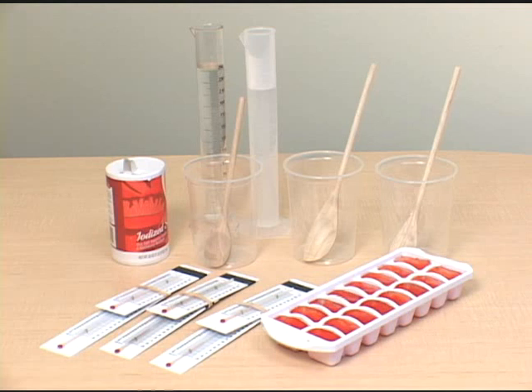Advanced preparation is important to lab work, so we gathered these materials prior to performing the lab.